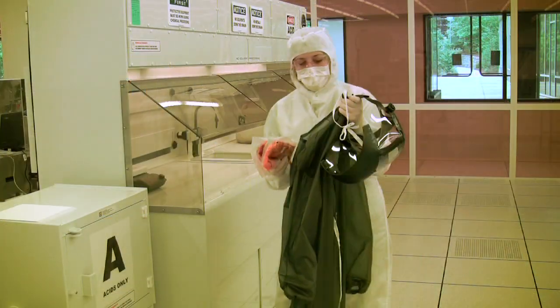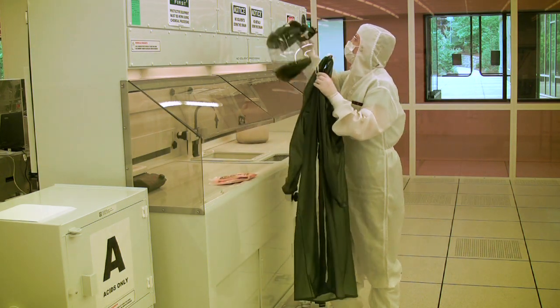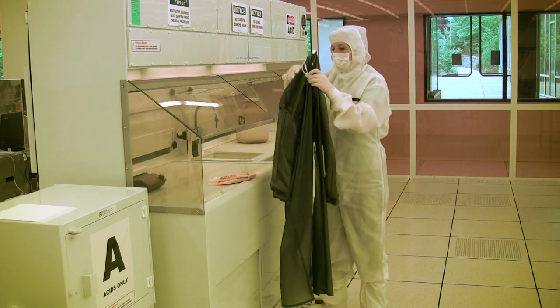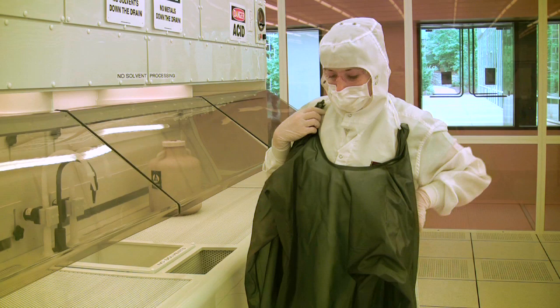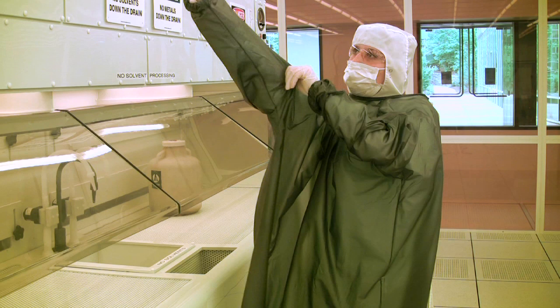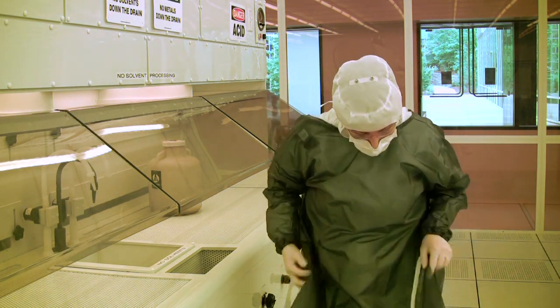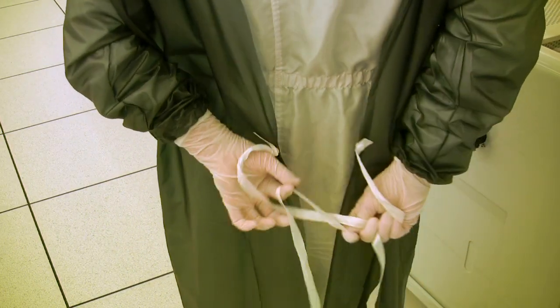When you put on the PPE, it should be done in the following order. The first item you will put on is the chemical resistant apron. Prior to putting the apron on, you should inspect the front of it for any tears, dampness, or residue. You may slide the top tie over your head and place your arms through the sleeves. There is another optional tie in the lower back portion of the apron; if you wish to use this, it must be tied in the back and not the front.